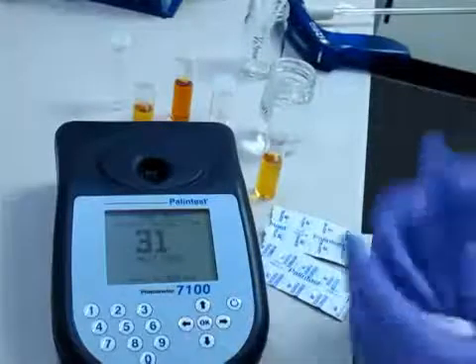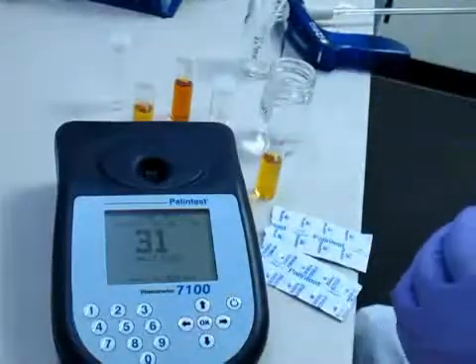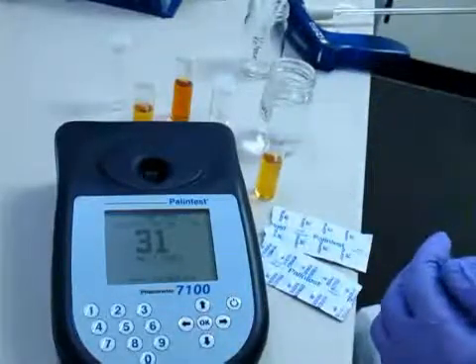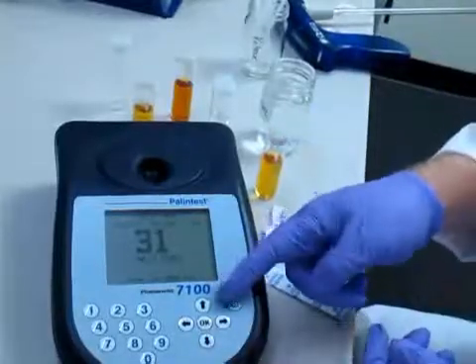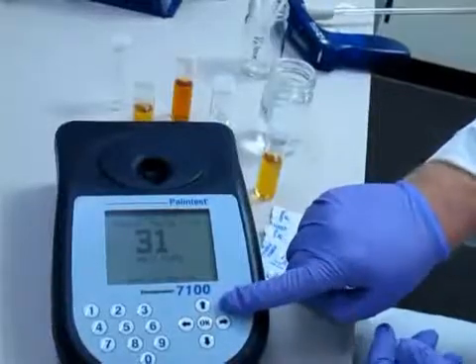So after you're done, just wash out the tubes and the instrument can be turned off with this power switch right here.